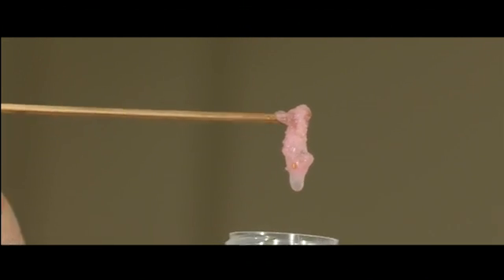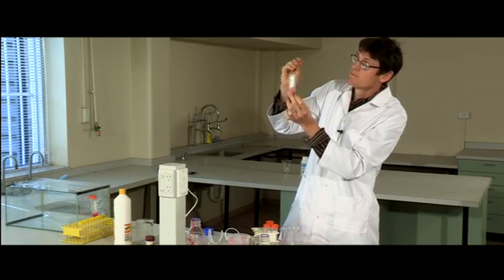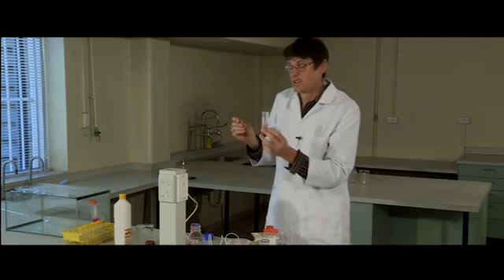And the longer you leave it, the more DNA will move into your alcohol layer. It's not a bad sample actually.